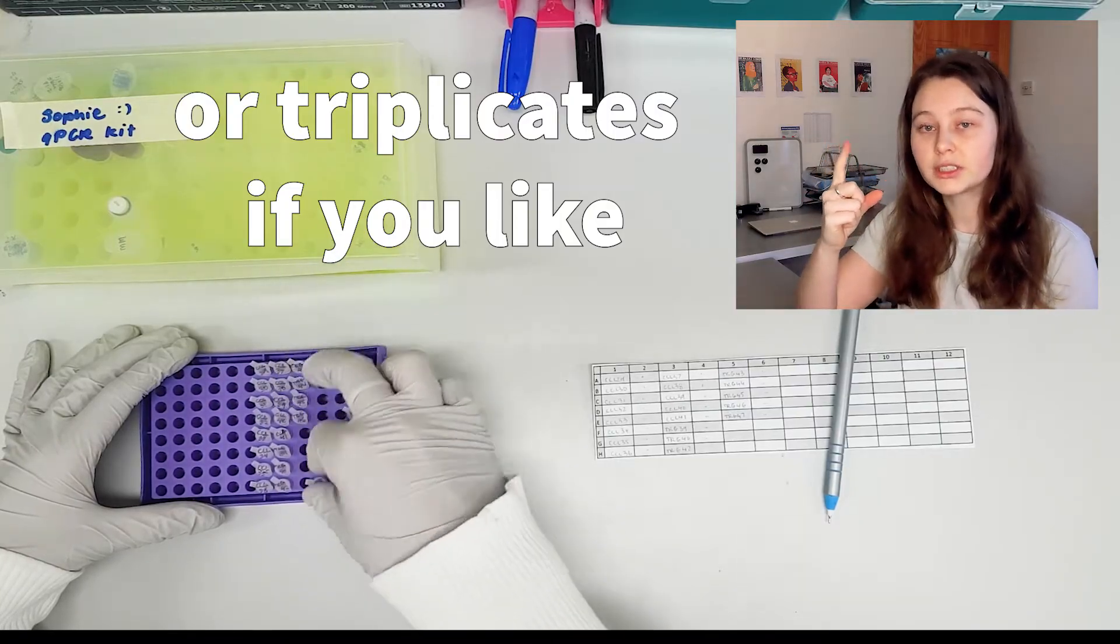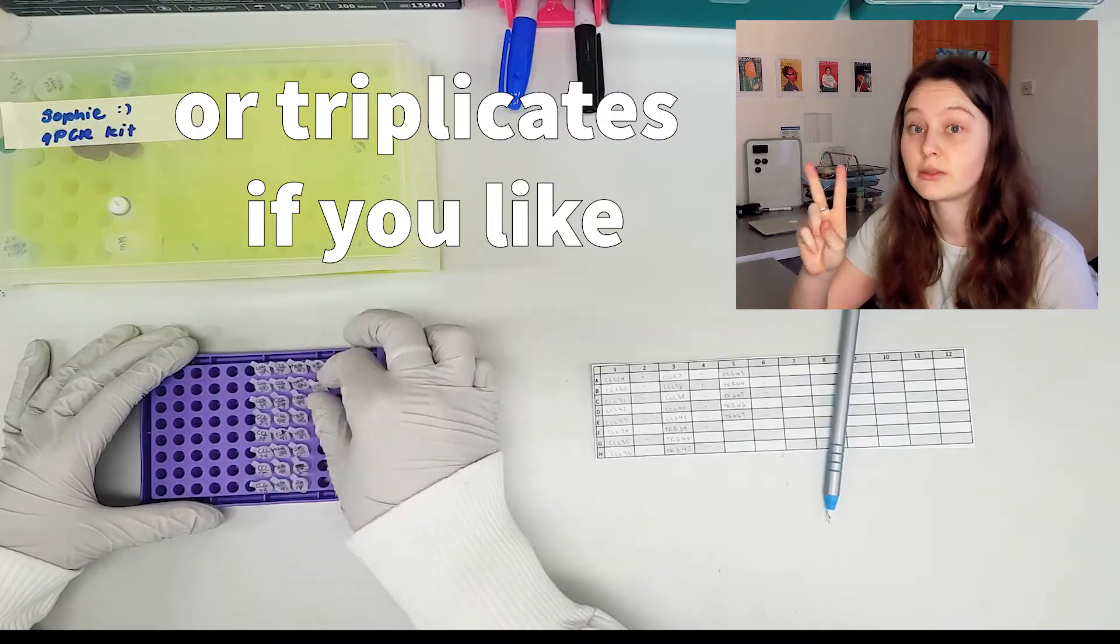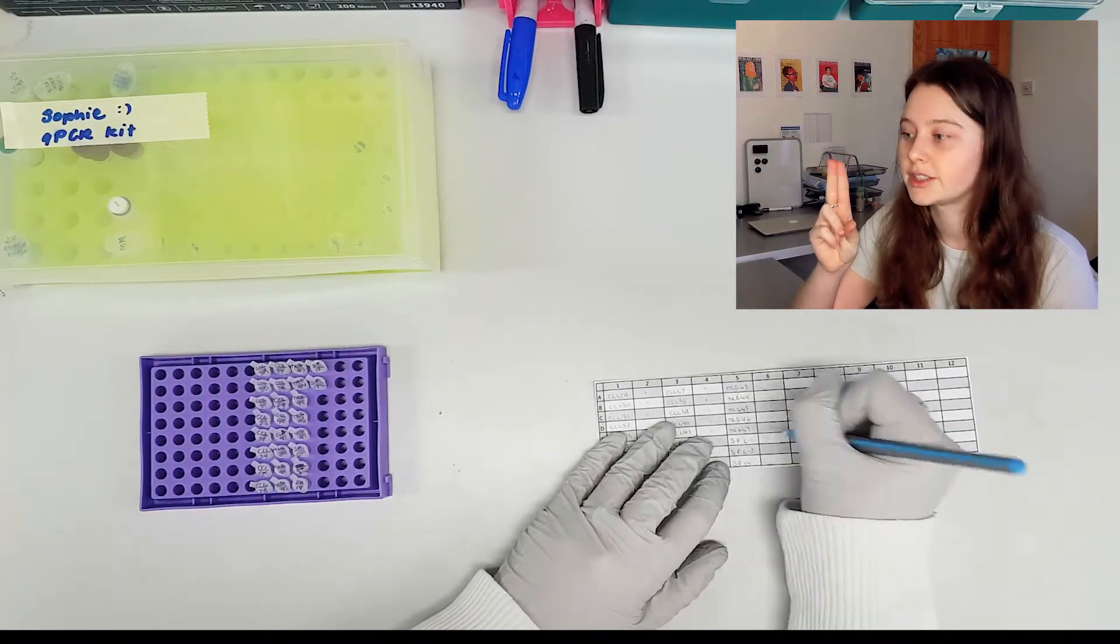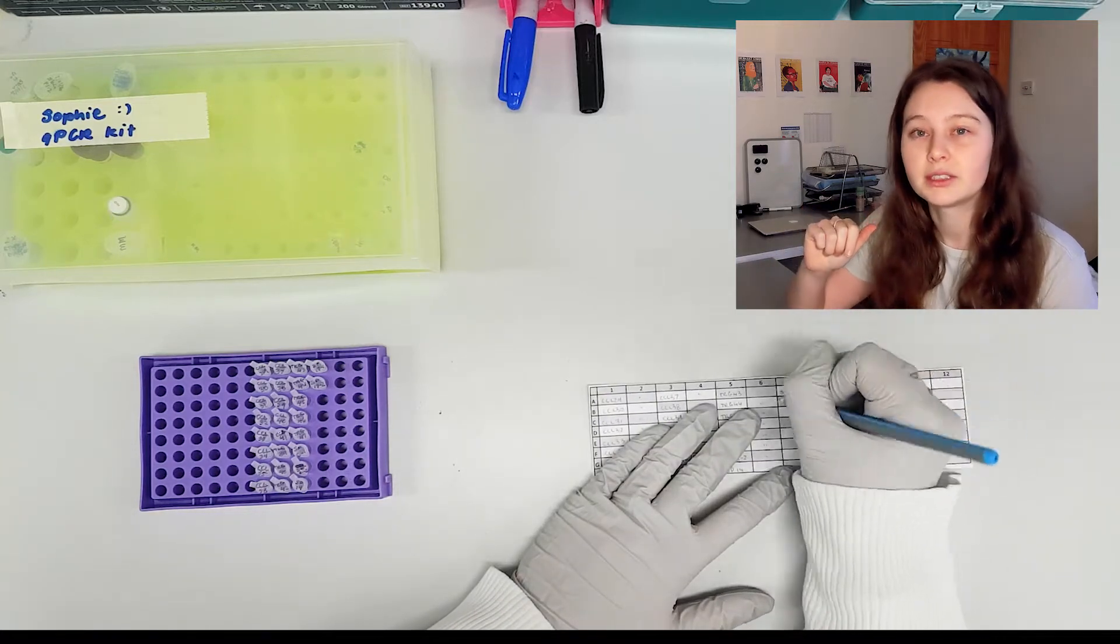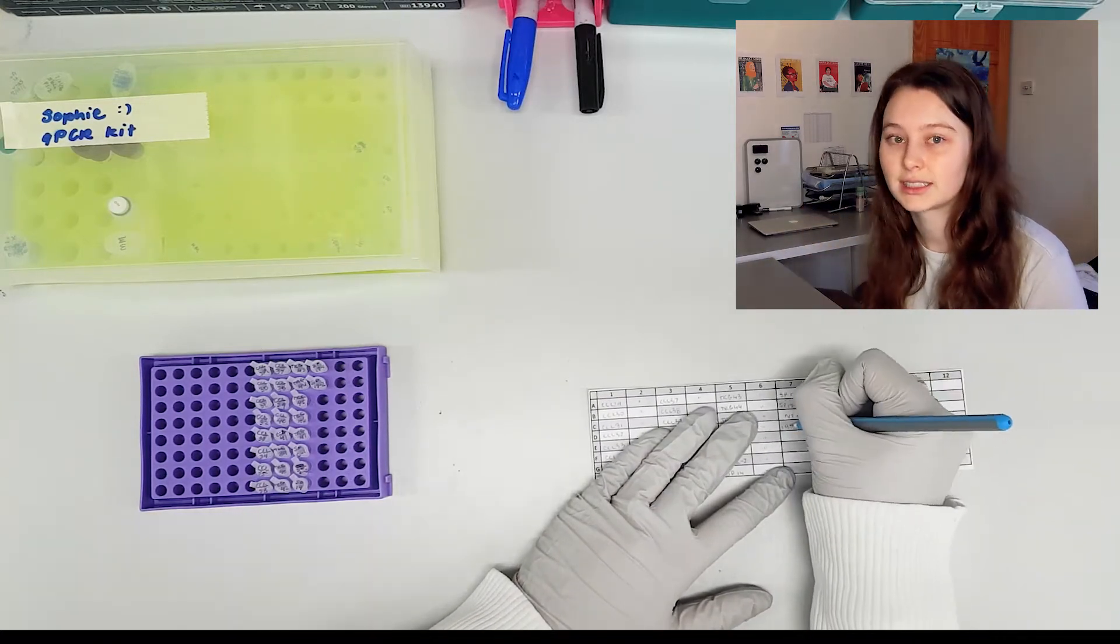You're not just running each sample once, you're running it twice to make sure there's no mistakes made. You want those two versions to agree with each other. So in this case that brings me to a total of 66 different samples.